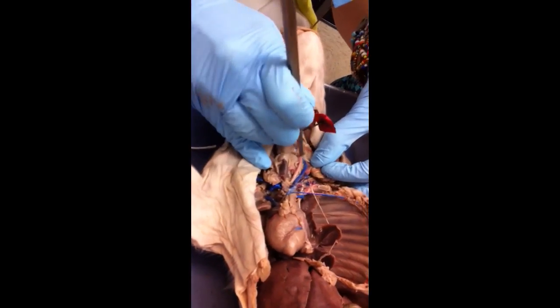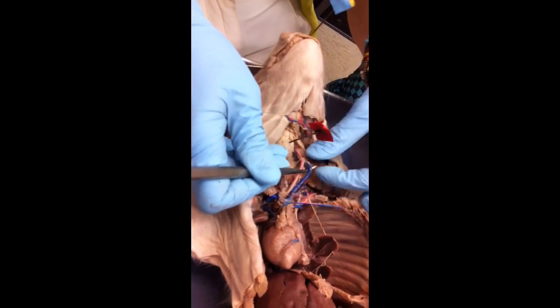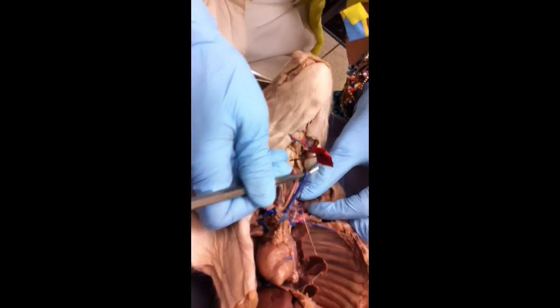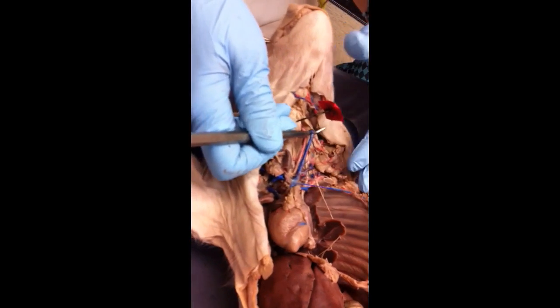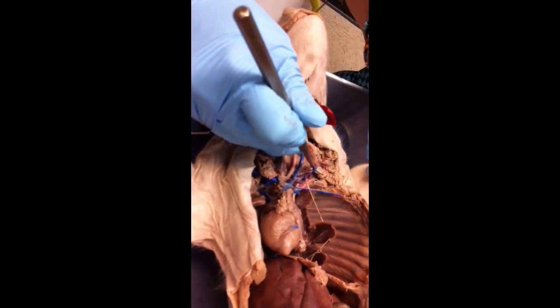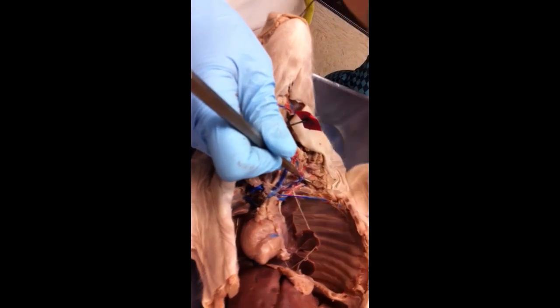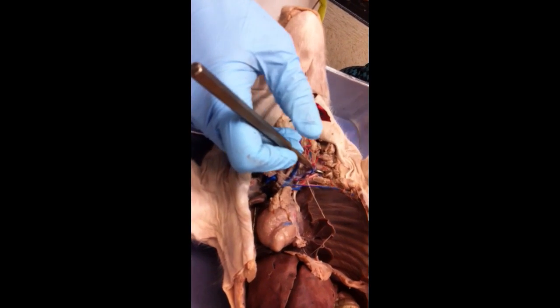So this one right next to it, that's blue, which jugular? This would be, yeah, left internal jugular vein, okay, whereas this one would be left external jugular vein. And based on if they're internal or external, you can tell where they're taking blood from.